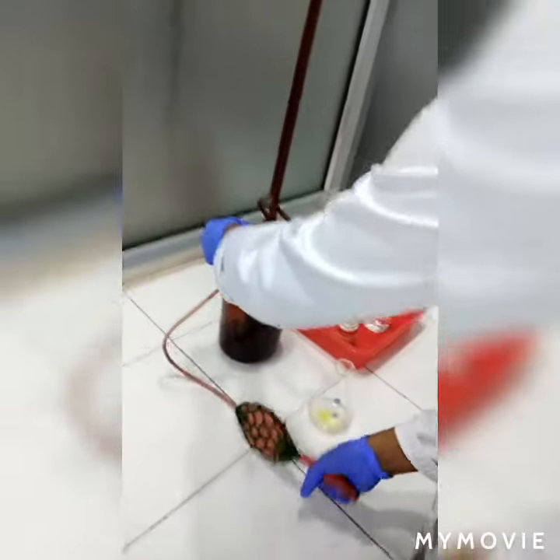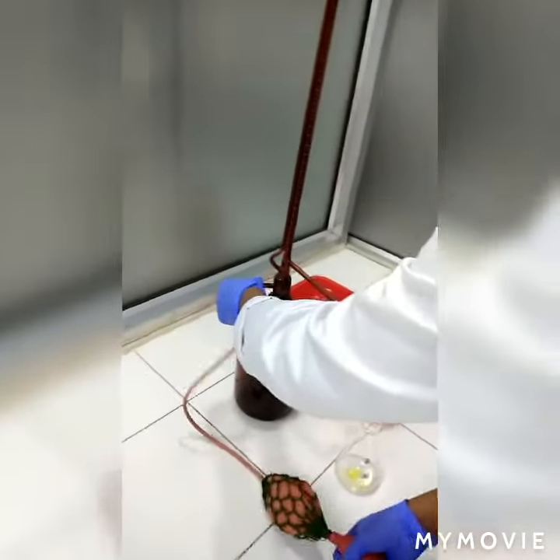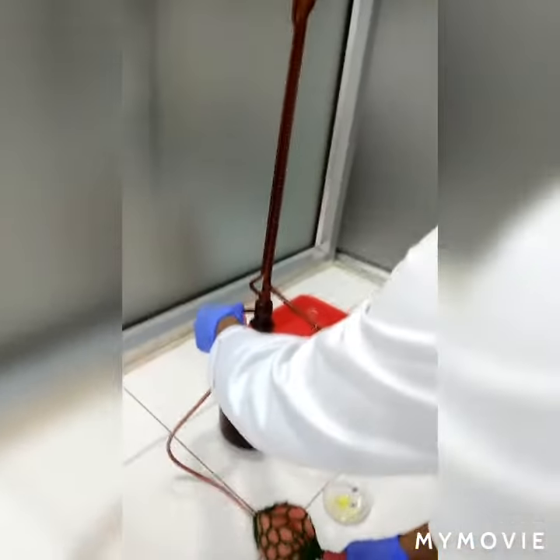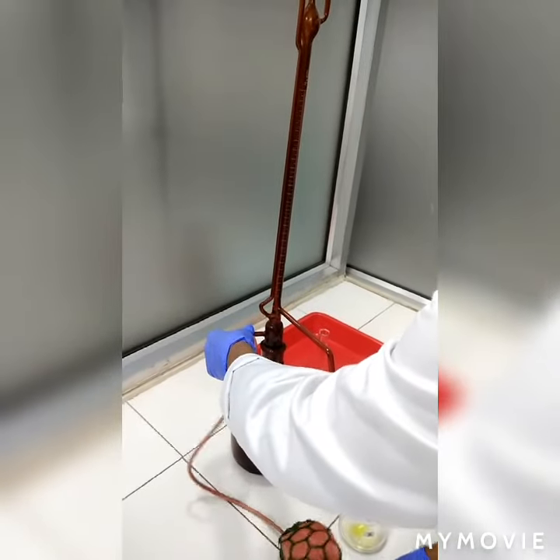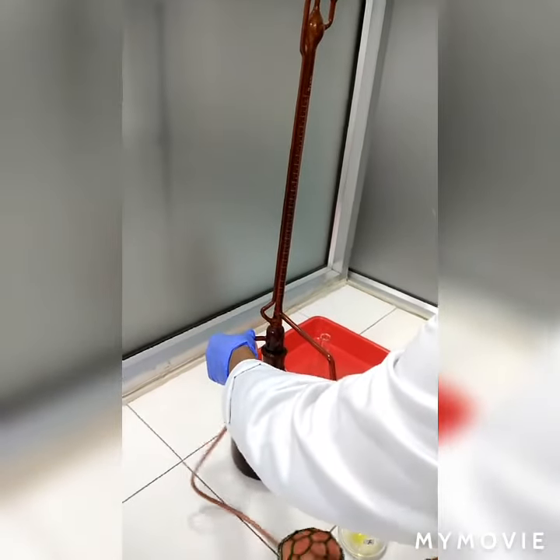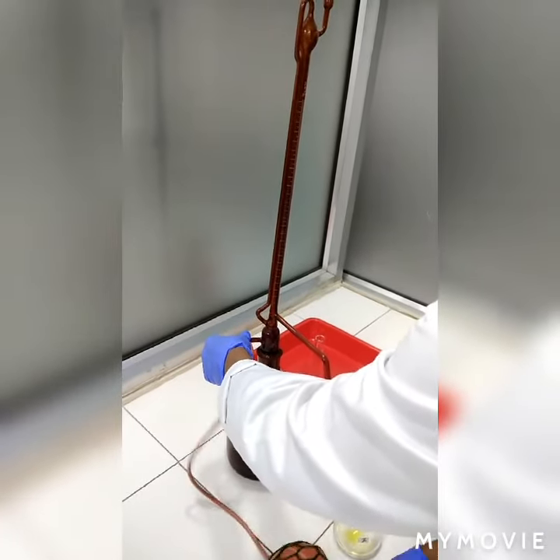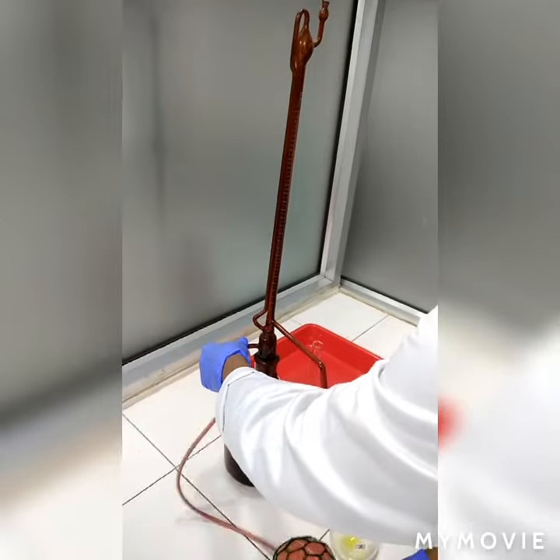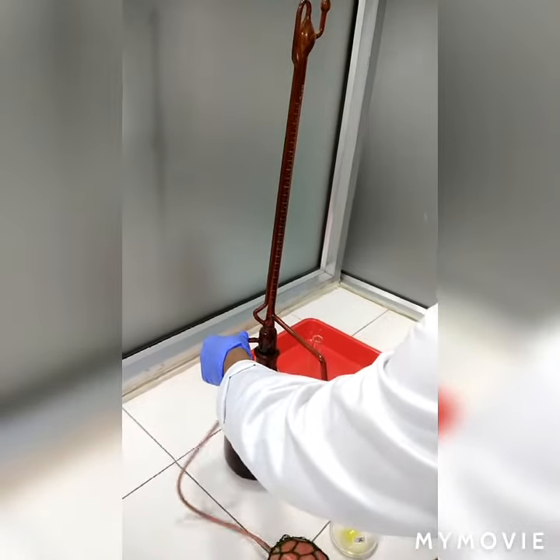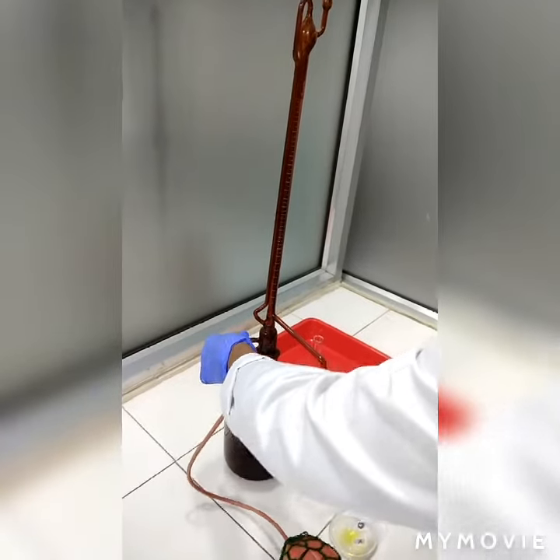This is an Auto-burette. We have to complete the setup so that it will be at Auto-Zero.